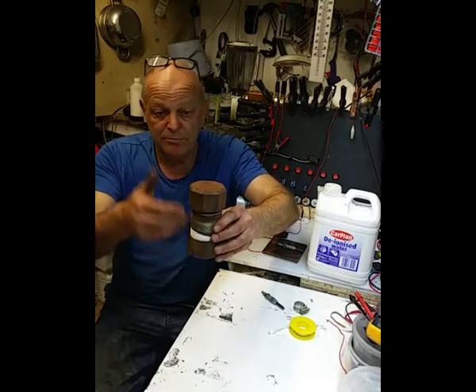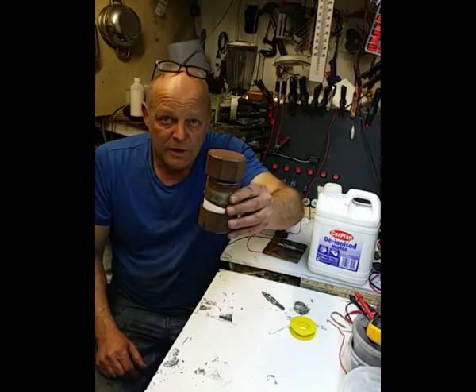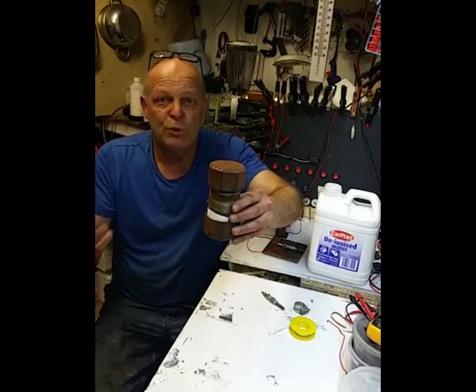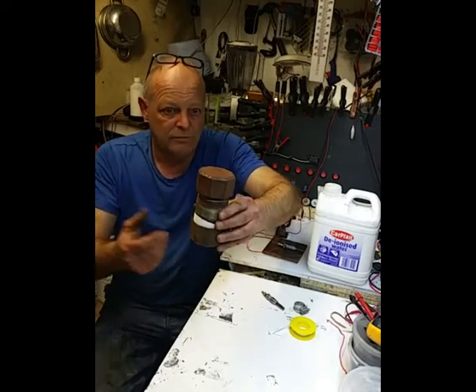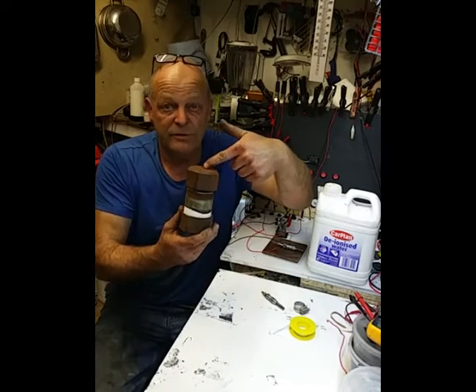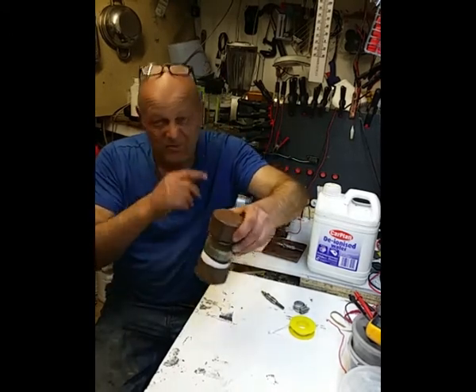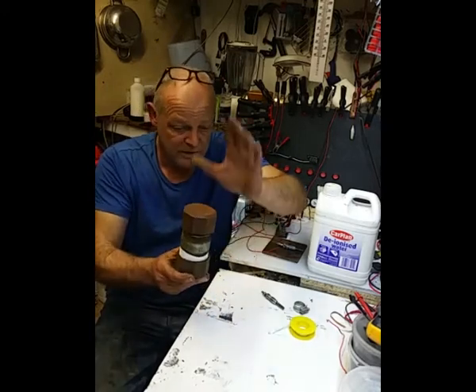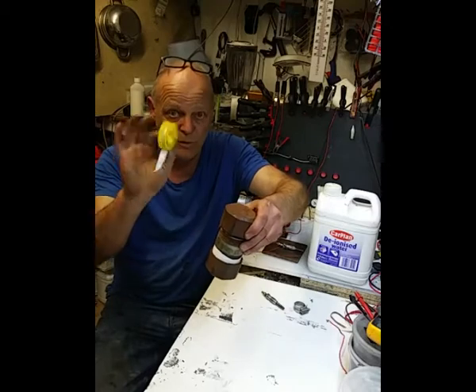It's a pipe fitting for hydrothermal carbonisation. Poor man's autoclave. I can't afford the one I want, so it's out of my reach at the moment, so I use this and it works. Obviously, you know, all the safety precautions and all the rest of it. You need to use the PTFE, the gas one, the yellow one.